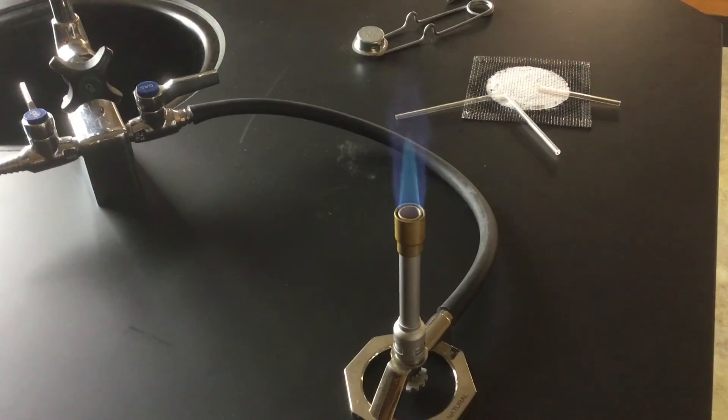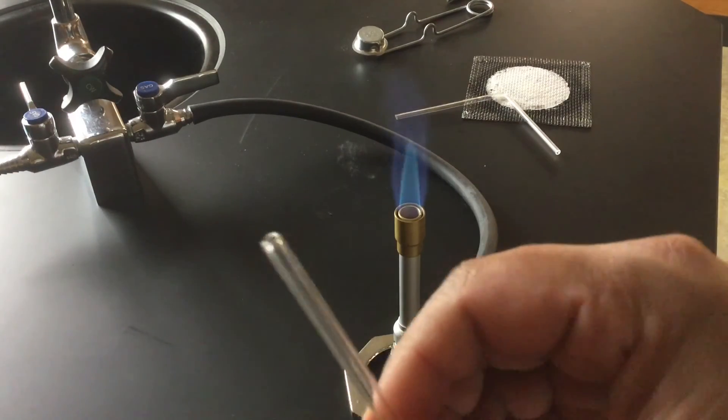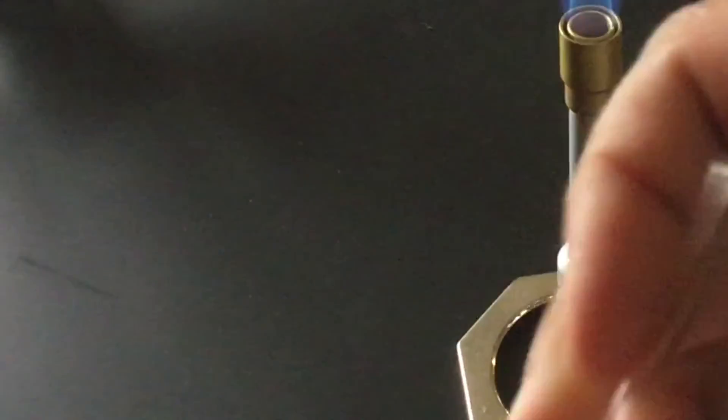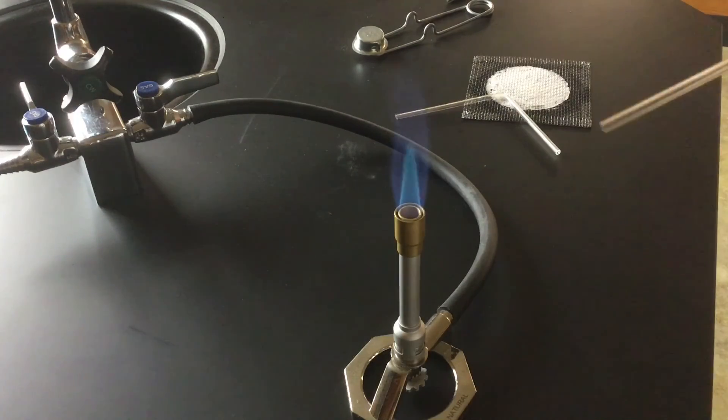10 minutes have passed and now it's time to fire polish the other end. So I feel a little bit better in holding this up to the camera so you can see how nice and smooth that is. If I run my finger over this, I can tell it's really smooth now. The other side still hasn't been smoothed out. So I'm going to fire polish this once again.